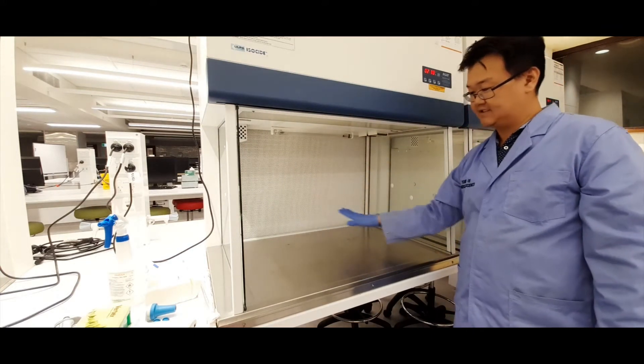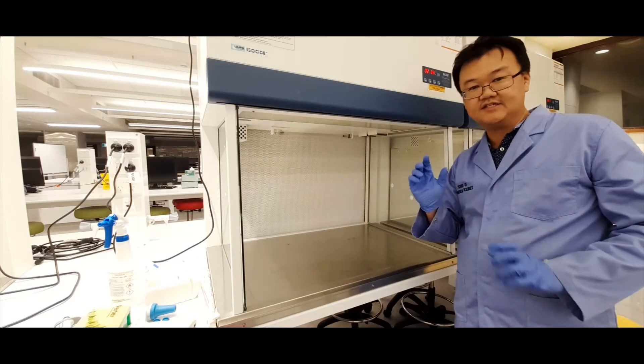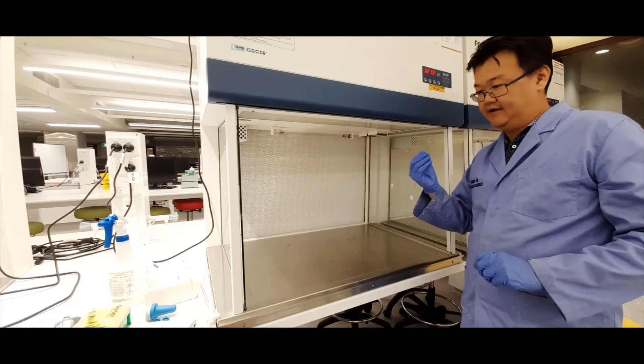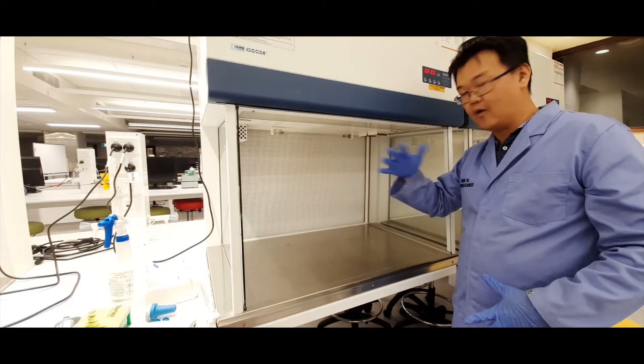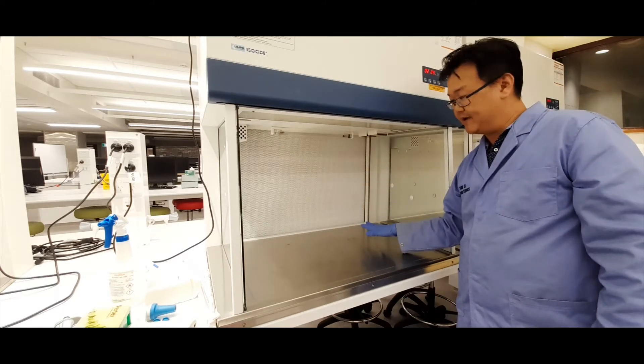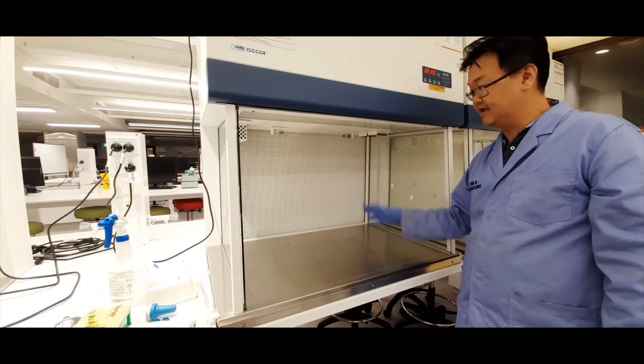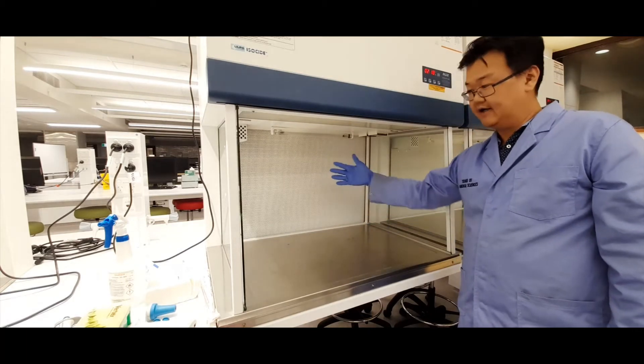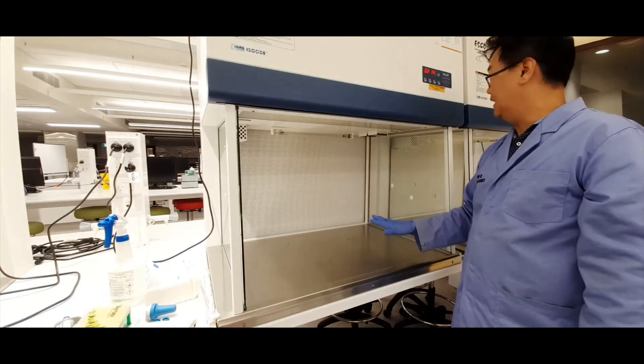In this way, it keeps any pathogens or bacteria or the spit from my mouth as I talk from going into the cabinet and falling on the surface, which is where you'll be working, and that's what maintains a sterile environment. So that flow of air is what keeps the inside of this chamber sterile.